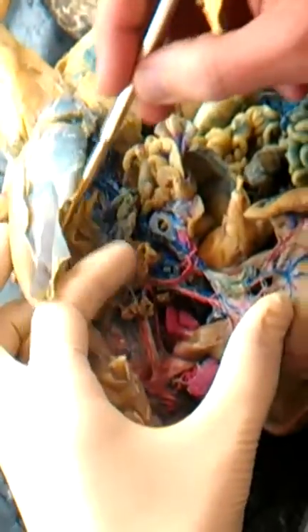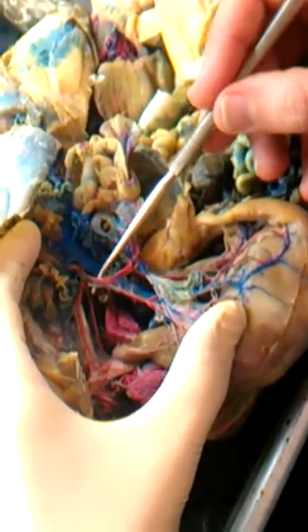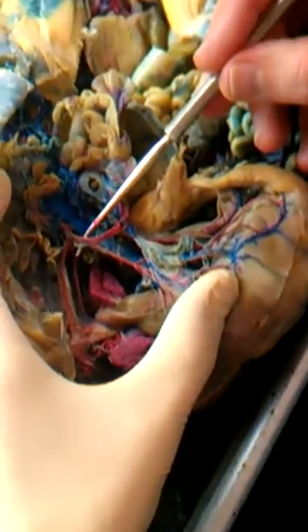Okay, continuing with the 2 systemic arches here, they join together to form the dorsal aorta. And let's see if we can find the dorsal aorta. And that is one here that runs kind of along the backbone, just underneath the vertebra. That's the dorsal aorta. And there are a couple branches off this one that you need to know. And that includes this first one here, which is almost as big as the dorsal aorta itself. This is the celiaco-mesenteric artery.